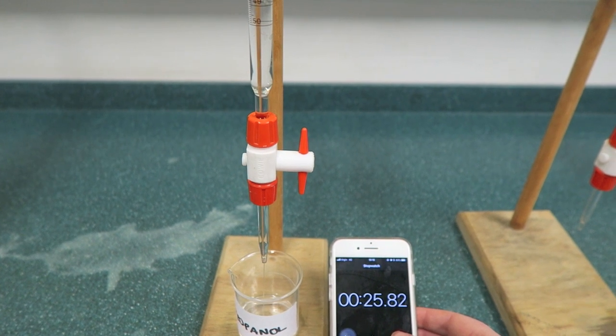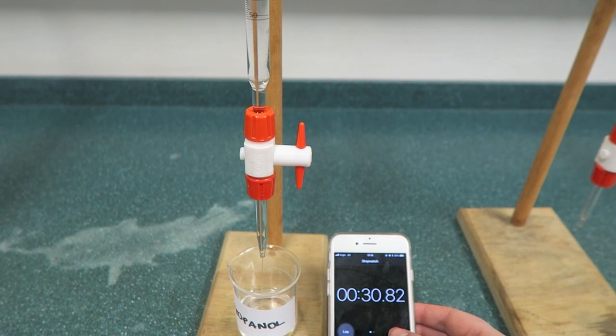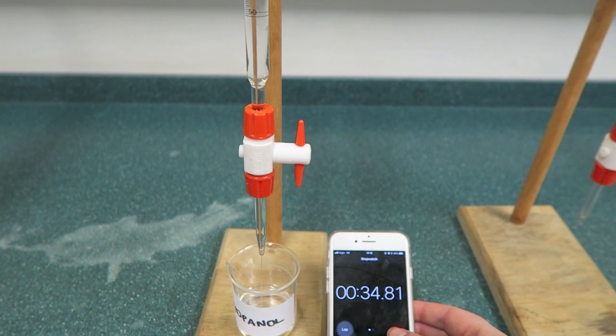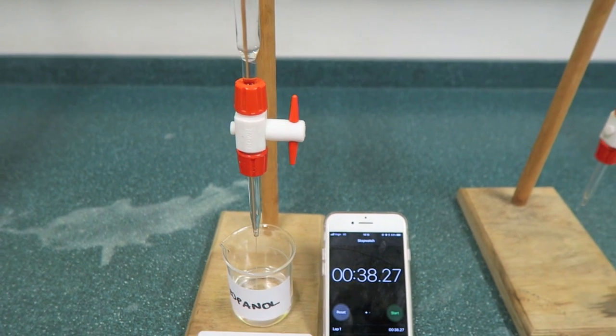This can be seen in the video as we're already past the 19 seconds that it took for 15 mils of propanone to empty from the burette. Propanol in fact takes around 38 seconds to empty out of the burette as can be seen in the video now.